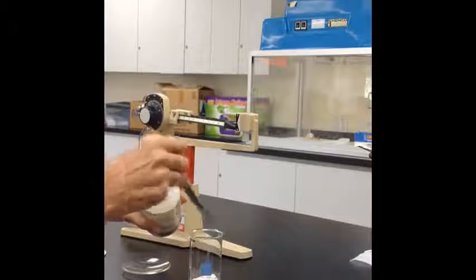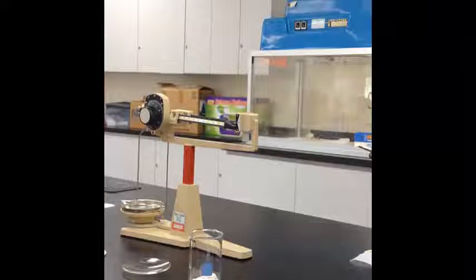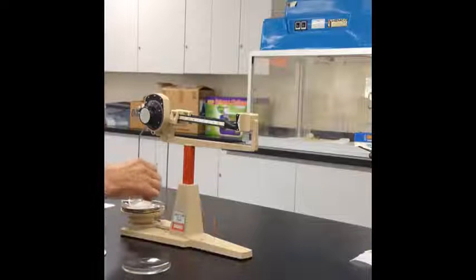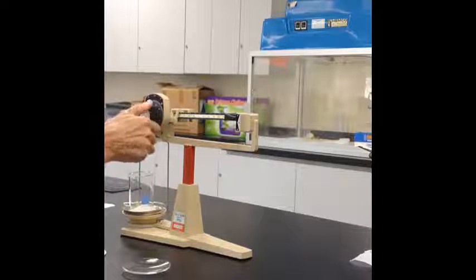And after we have completed that initial preparation, we'll obtain a small sample of the mixture of salt and sand. We'll then determine the mass of the beaker containing the salt and the sand, and this will allow us to determine the actual mass of the mixture itself. And once we've actually determined the mass, we need to set up our filter paper.